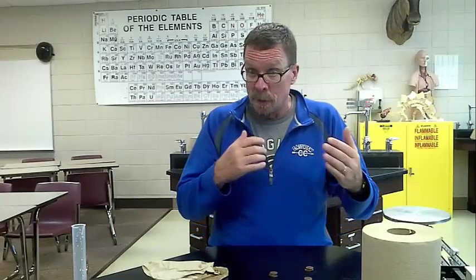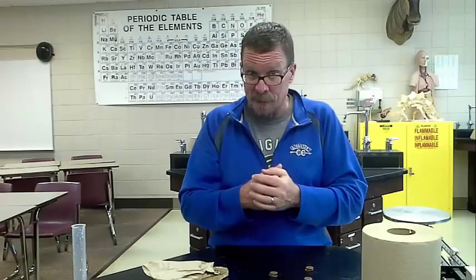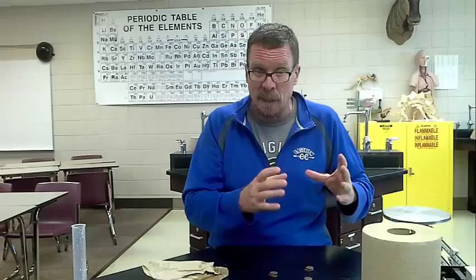Then I'm going to clean and dry those all off, and go trade again. So you have to do the same thing for each set of years with 3 different sets of pennies. It shouldn't take very long. You may go and trade twice with 2 other groups and get some new pennies.